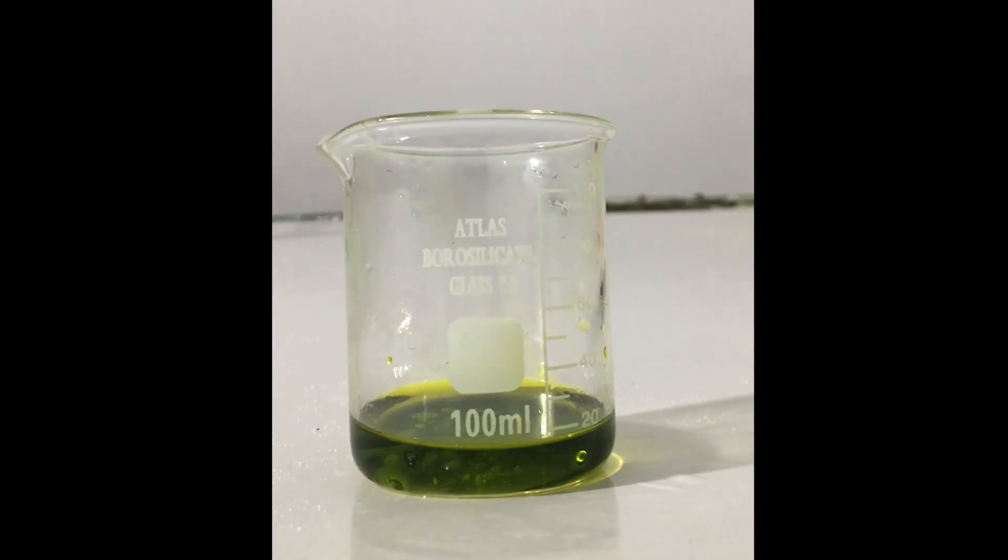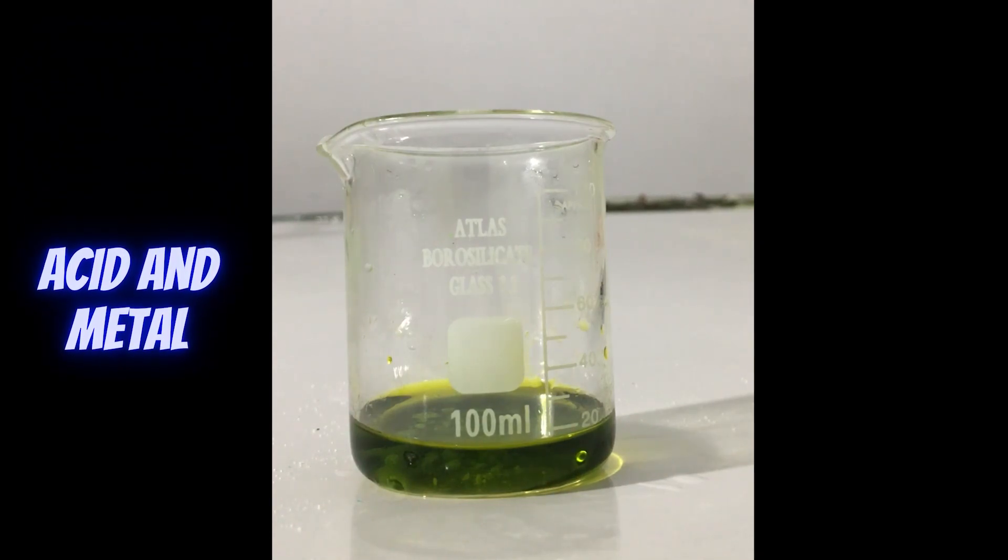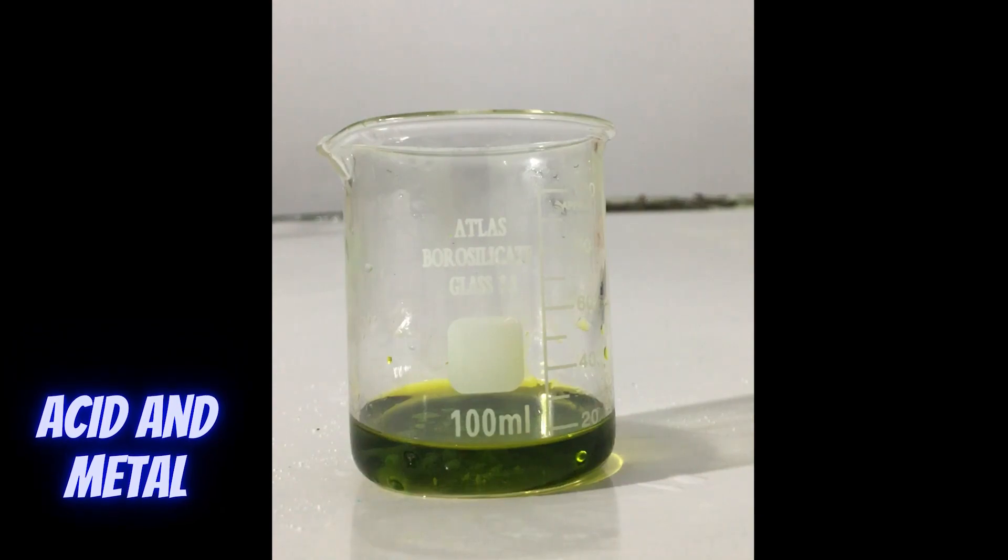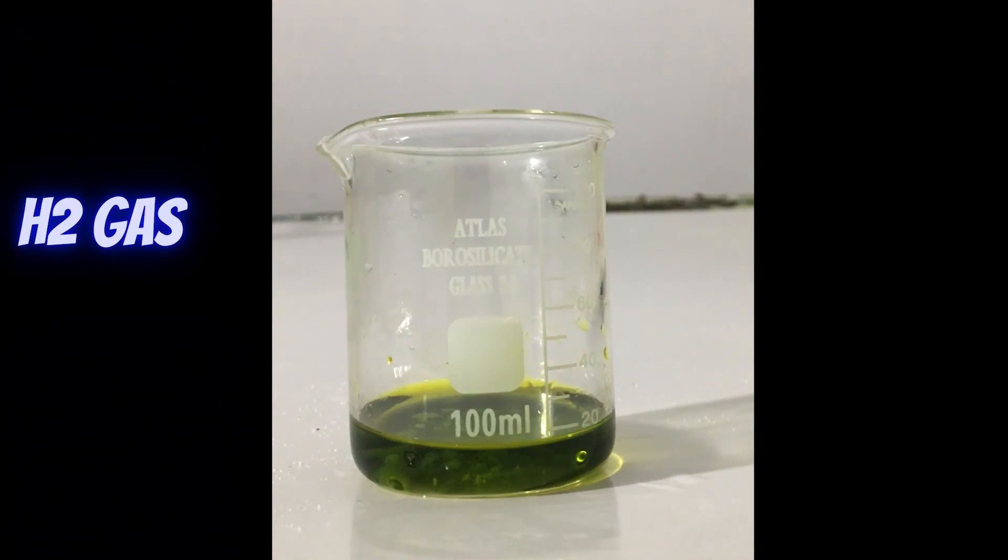Hi everyone, today we will perform a short experiment between acid and metal. We will observe how acid reacts with metal and notice the release of hydrogen gas by introducing a flame.